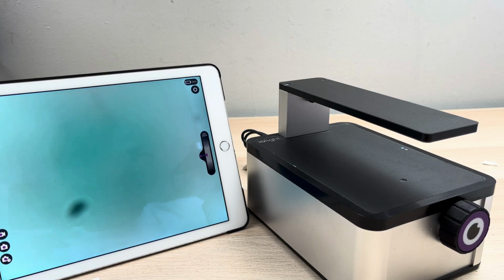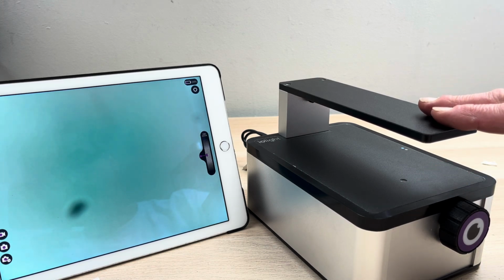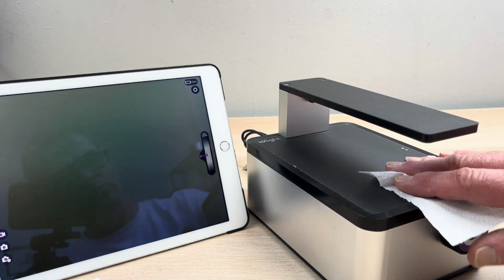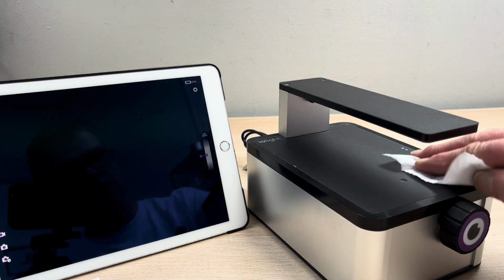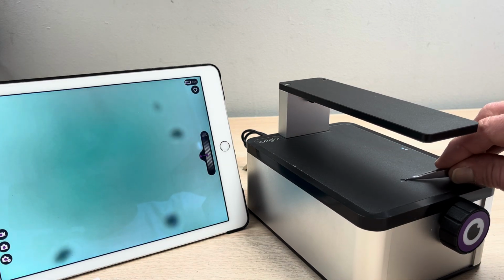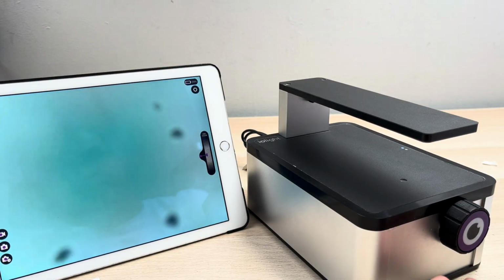In this little short video, I'd like to explain how to clean the little optical window on your ioLight compact cell imager. So what often happens is you're trying to clean the stage, you wipe over it with just a normal tissue. And what happens, of course, is you actually wipe dirt into the little optical window here. So you can see on the screen now that we've got all sorts of bits of dirt.